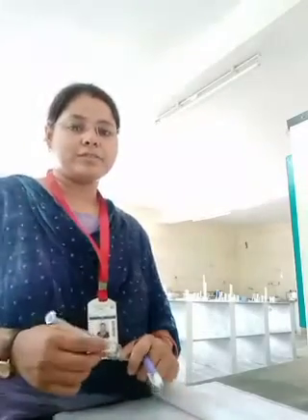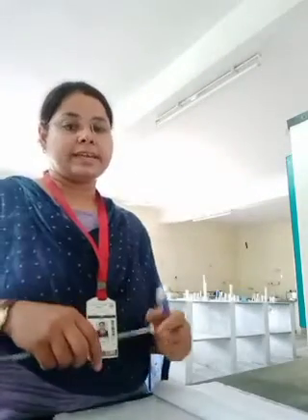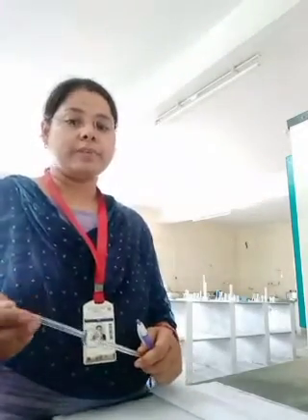Hello students, I am Sarika, assistant professor in Bharti College of Pharmacy. Today we will discuss a practical video whose objective is the determination of surface tension of liquid by the drop count method.